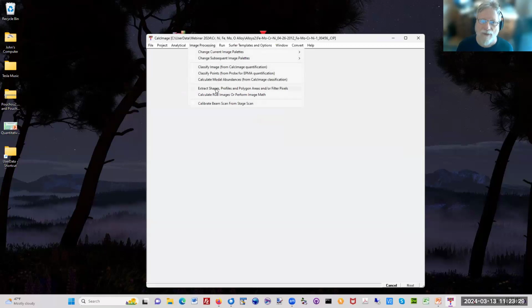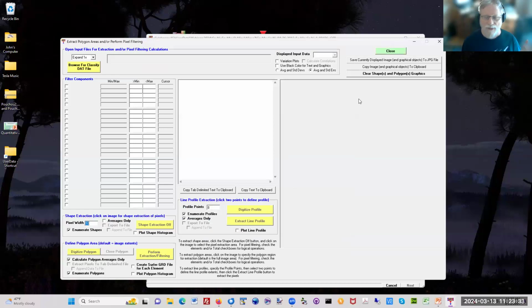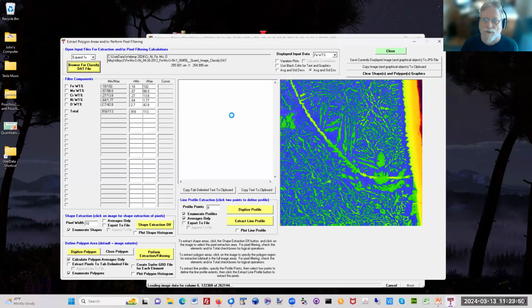And then here's back to where we extract the pixel shapes. There's a lot of things you can do in this CalcImage software, reprocessing your quant maps. Of course, you can do all the same operations on your raw intensity maps. Well, why would you? So here I'm going to load in the quant map. It could be oxides, it could be atomic percents. You decide what map would be most useful for you to do your work on. So here's an example of the digitized polygon. I'm going to say, just give me, I don't know, this area here.